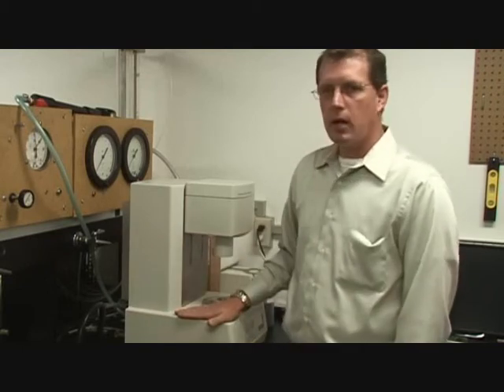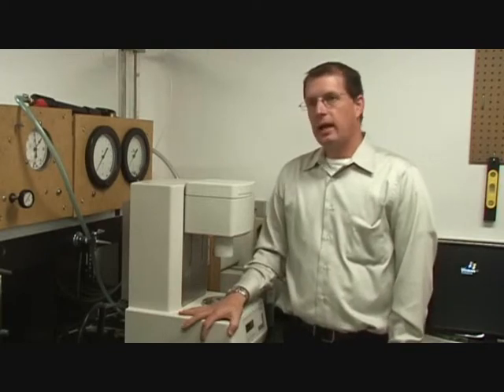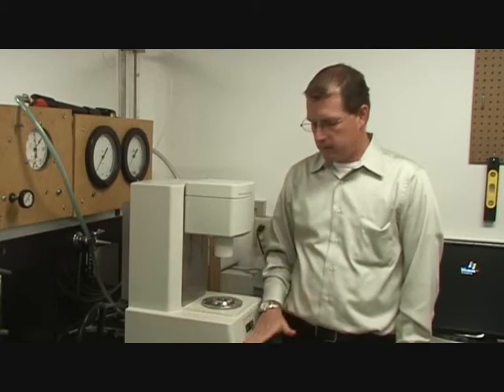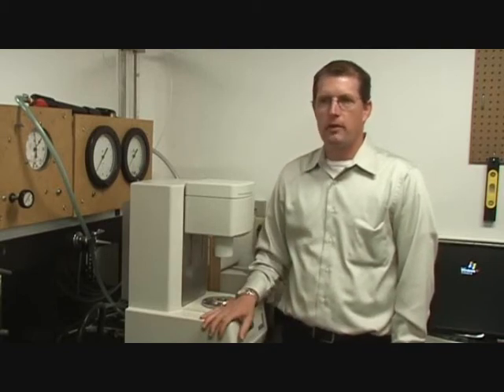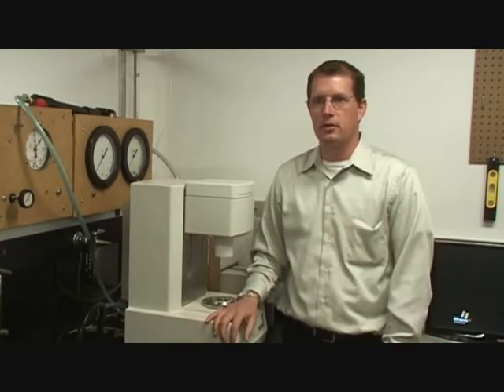So how much air pressure do you need, Scott? You need between, we say, 80 and 120 psi. That said, I've worked as low as about 50 psi. There's an air switch in there. It's just an electrical switch. As long as that doesn't shut off, you're fine.